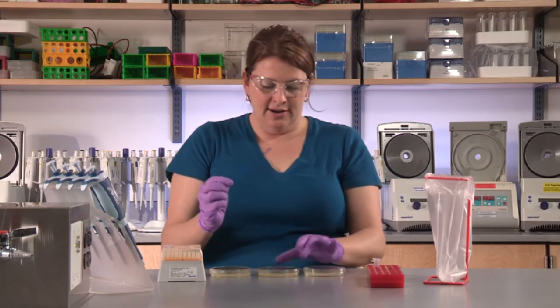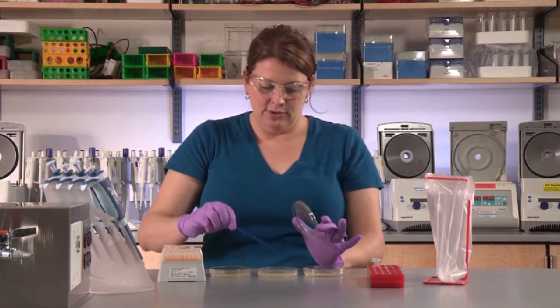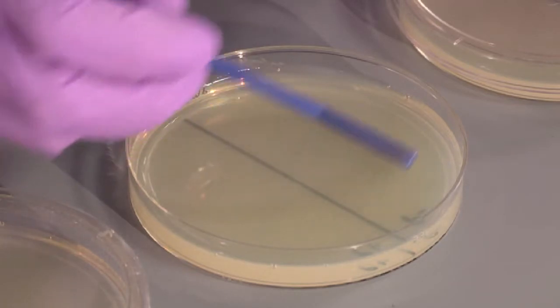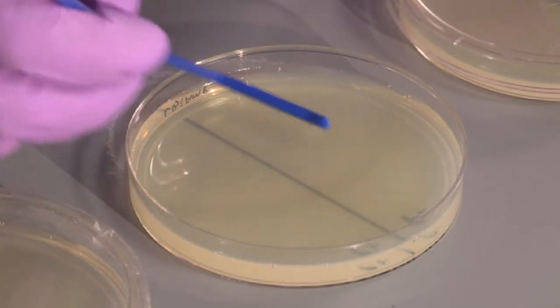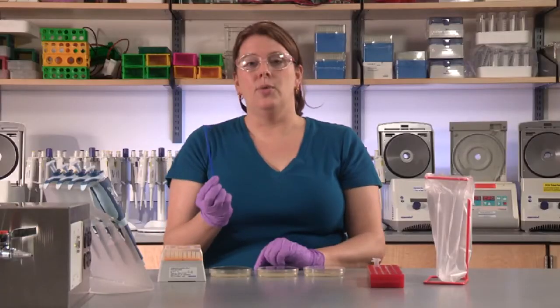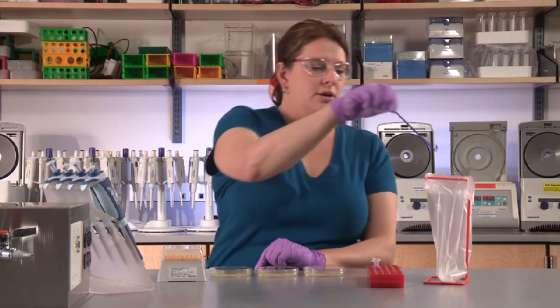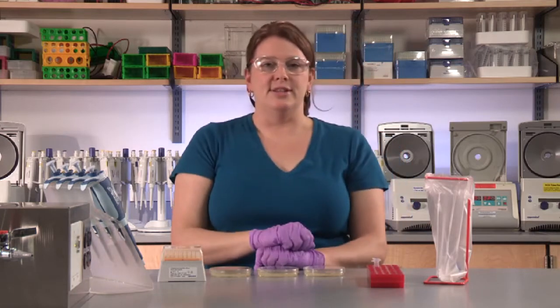Try not to gouge the agar, and remember, this isn't a shovel. Very gently spread the cells, being careful not to cross the border into P+. When you're finished, be certain to put the bacterial cell spreader into the bag.